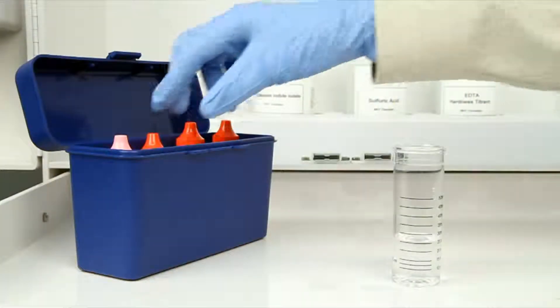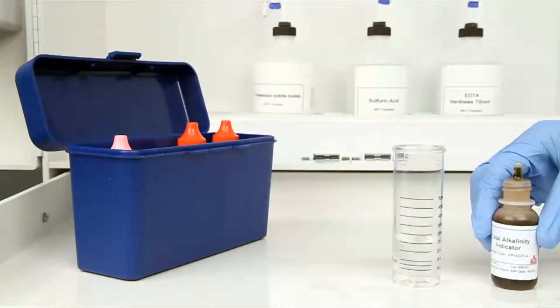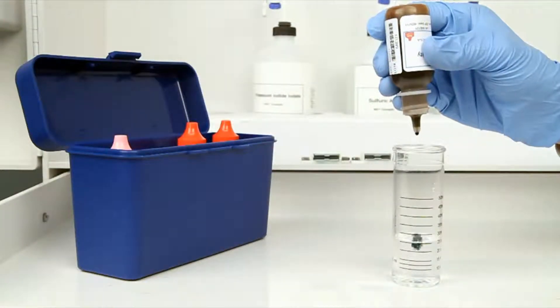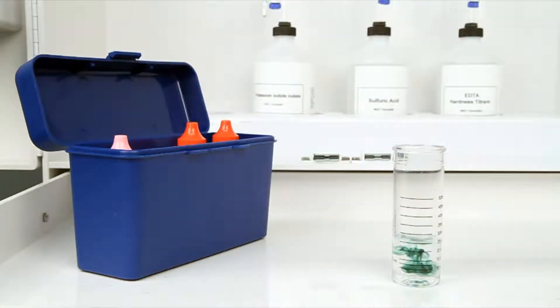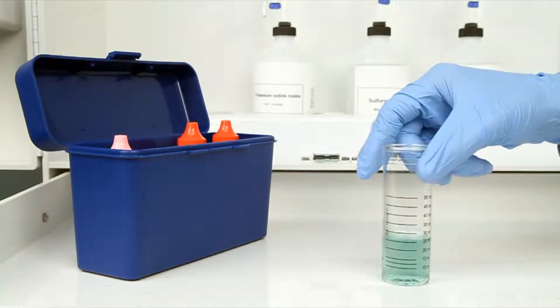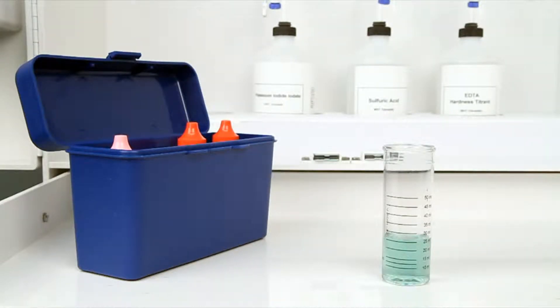The next step according to the endpoint ID procedure is to add three drops of the total alkalinity indicator. The bottle contains a dropper tip, so it's important to hold the bottle vertically to get a consistent drop size. After the addition of each reagent, it's important to swirl the vial to make sure the reagents are properly mixed. In this example, the sample is turned green, indicating that there is still alkalinity that needs to be titrated.